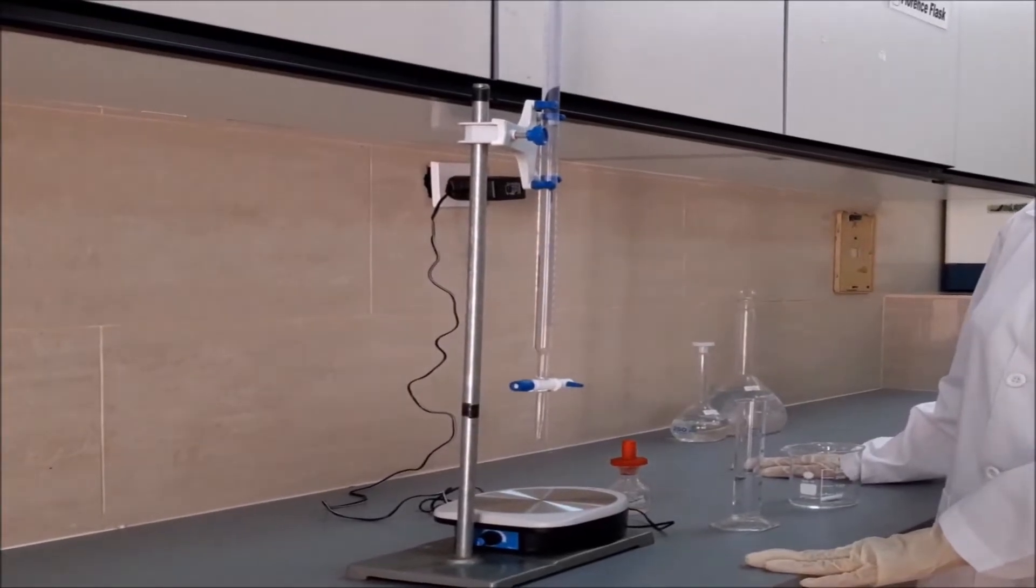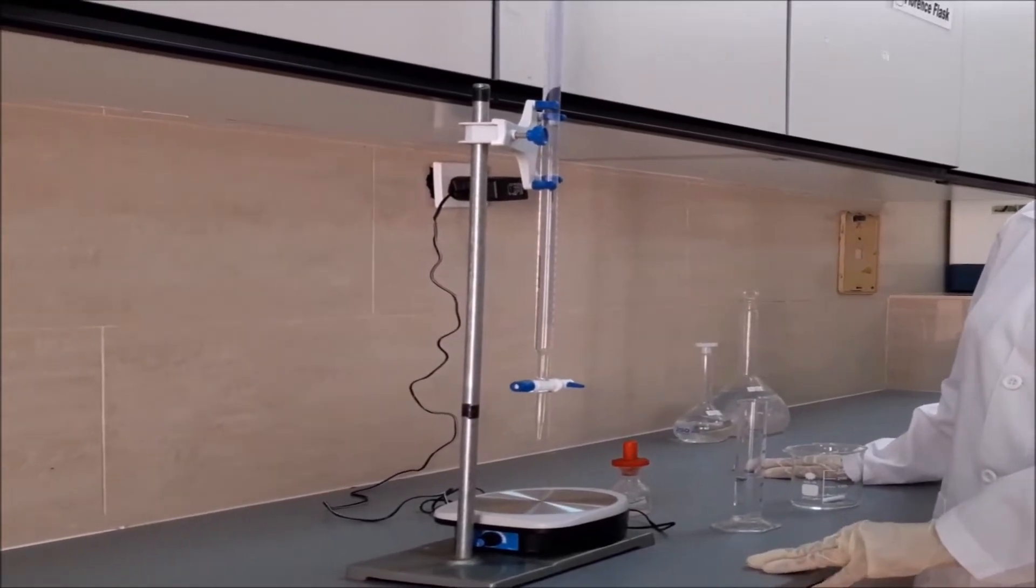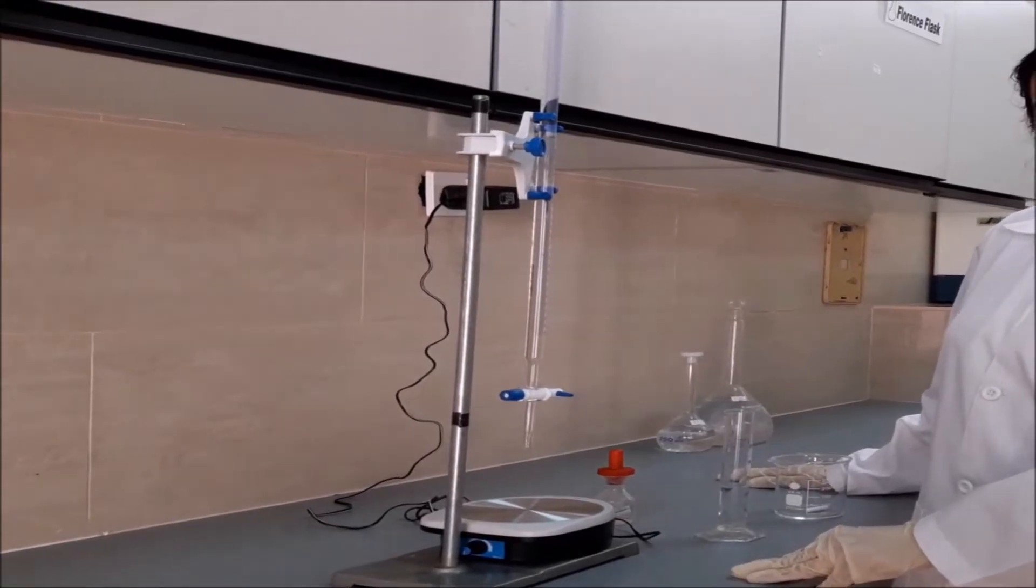In today's video, we're going to do the titration between sulfuric acid and sodium hydroxide.